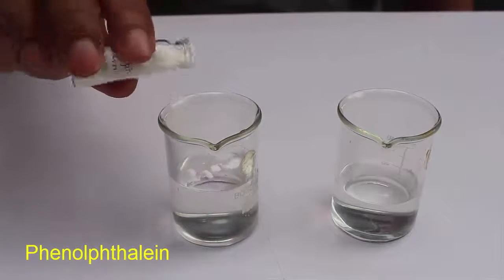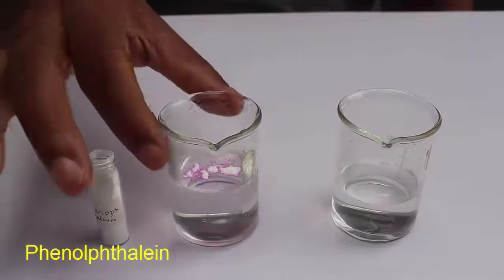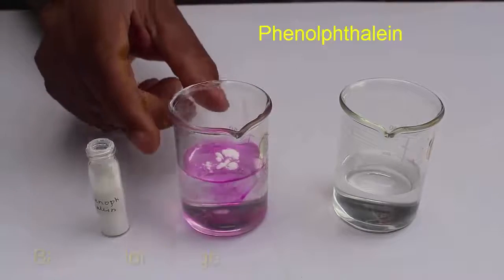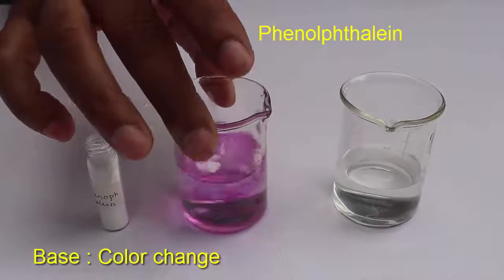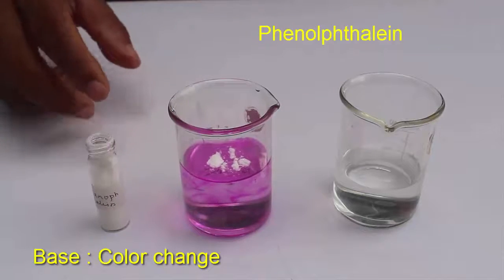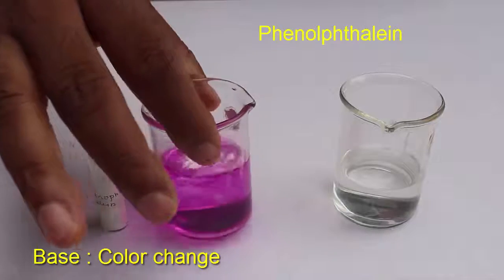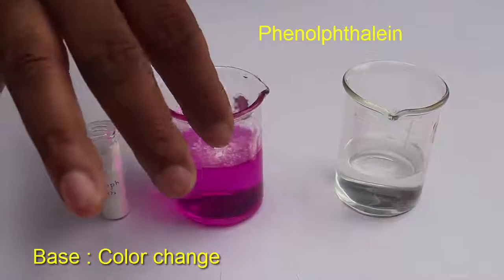Immediately on adding phenolphthalein, you will see a change in color — this solution will start becoming pink. This means that this solution was a base. On stirring the mixture, the whole solution will soon become uniformly pink.